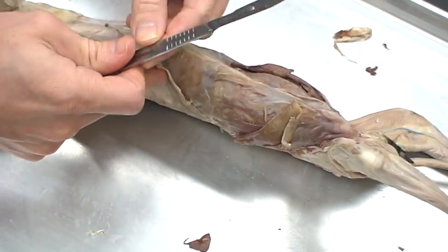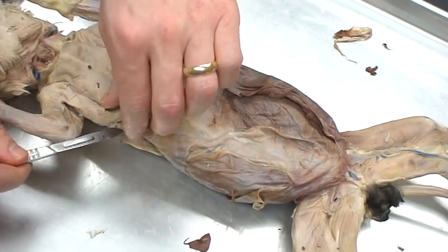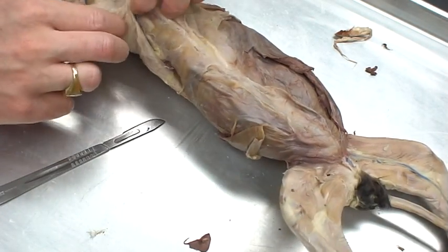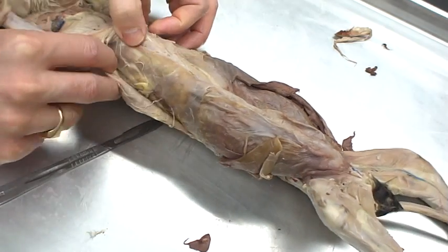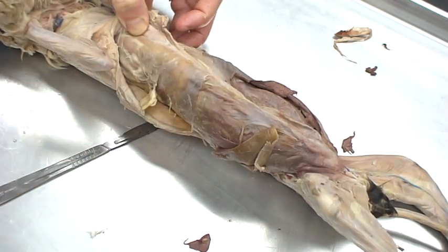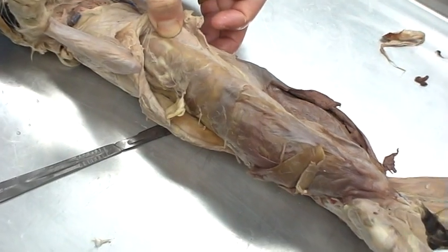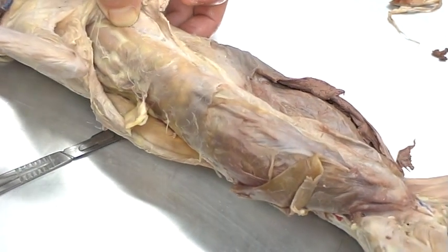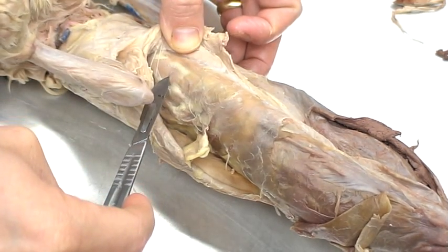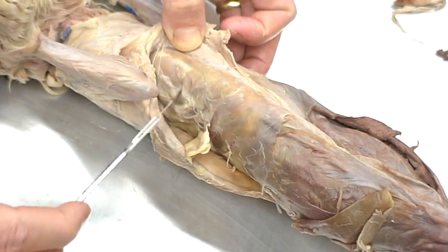It's actually kind of interesting to see if you look underneath — I'm going to cut this away. Normally I don't have students do this, but just so you can see where they're at, you'll be able to see in the armpit region right here there's some fat over the top, but if we look at that, what we'll be able to see are the serratus anterior. Looking at these muscles, serratus anterior would be one, two, three, four, and there's actually a fifth one back here.